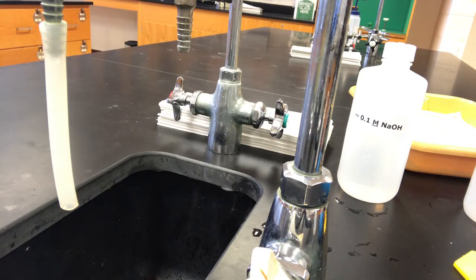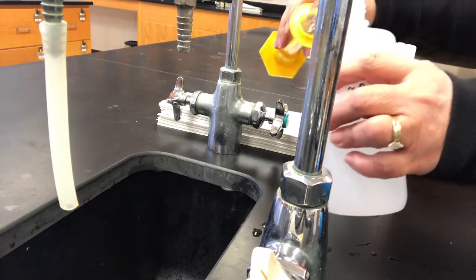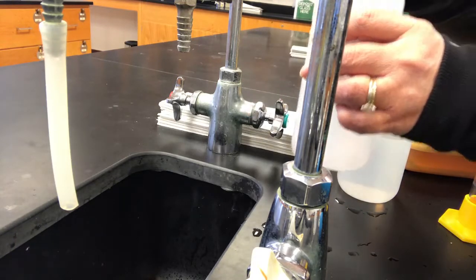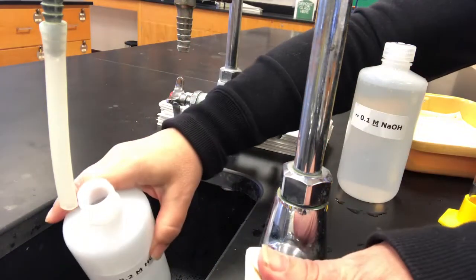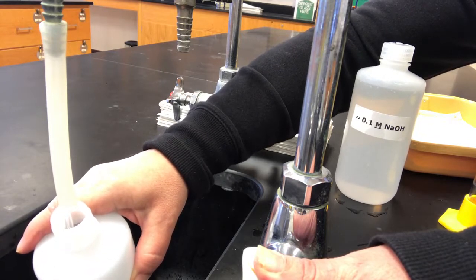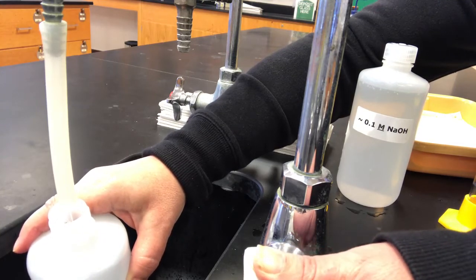So I calculated how much hydrochloric acid of the 5 molar that I'm going to need in order to produce a 500 milliliter container of 0.2 molar hydrochloric acid. So here is my measured hydrochloric acid. I will pour it into the bottle. And then notice I'd already half filled the bottle with water. You want to always do that. You don't want to add water directly to a concentrated reagent, because sometimes a lot of heat will be let off by the abrupt ionization of the dissolved components. Depends on what it is, and it can be quite dangerous.